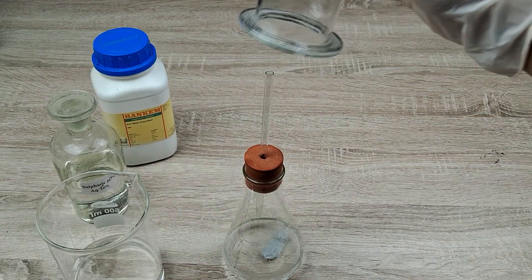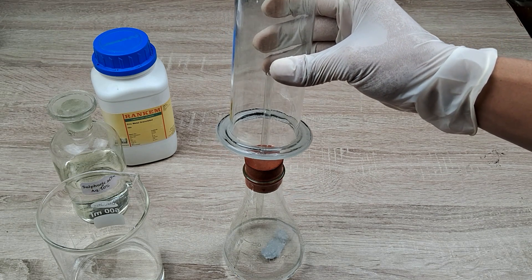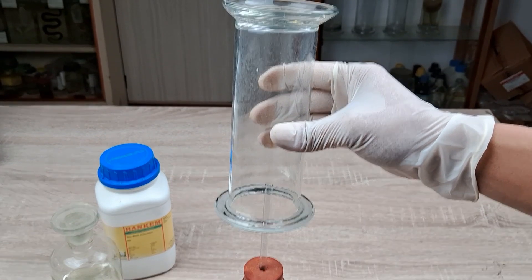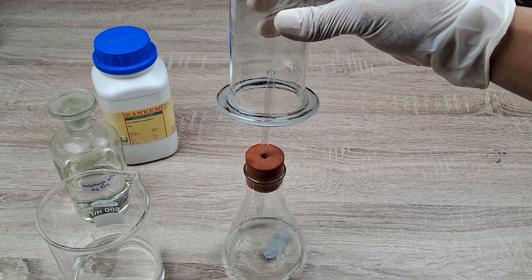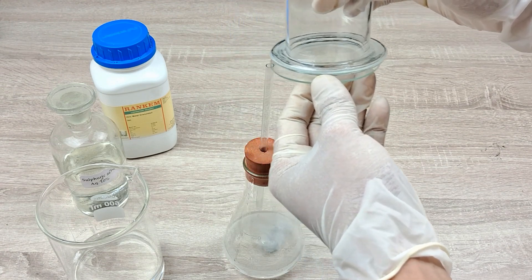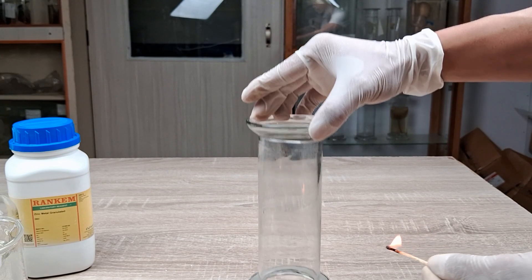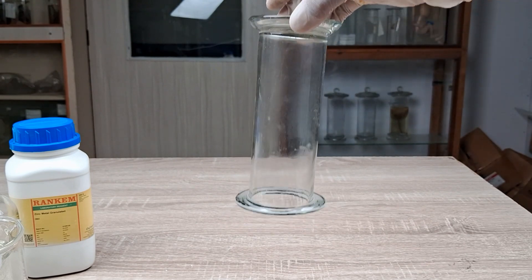After 30 seconds to a minute, hold the gas jar in the inverted position over the end of the tube so that a few centimeters of the tube goes into the mouth of the gas jar. Collect the hydrogen gas in the inverted gas jar for about 1 to 2 minutes, by which time the jar would have been fully filled with hydrogen gas. Cover the mouth of the gas jar with a glass lid while still holding the jar inverted. Remove the reaction flask to a safe distance. Then light a matchstick or splinter, remove the glass lid from the gas jar, and introduce the burning splinter at the mouth of the gas jar. Record your observation.